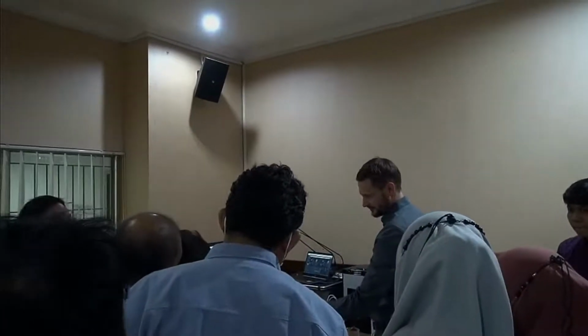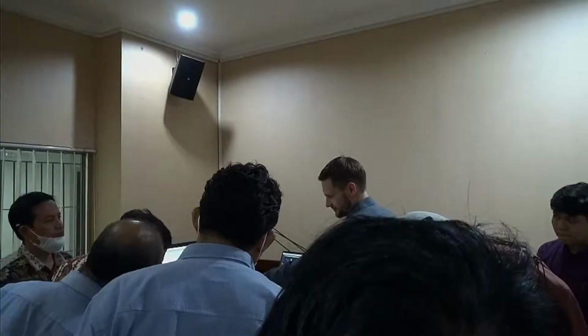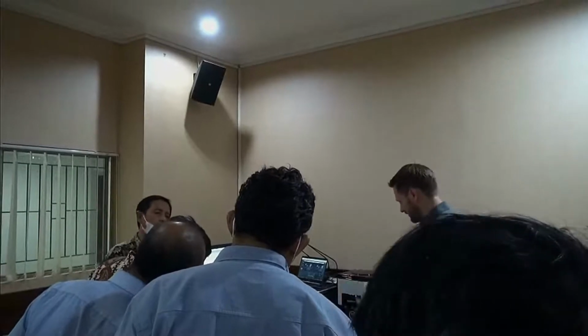It's a dark measurement first, you see no signals. Next thing is background measurement. Now you see some signals, because this detector is right next to the main beam physically, and it always catches some stray light. But for that reason, we do a background measurement, which we then deduct from our actual sample measurement, speaking of which, we are ready to do that. So now it tells us enter sample now.